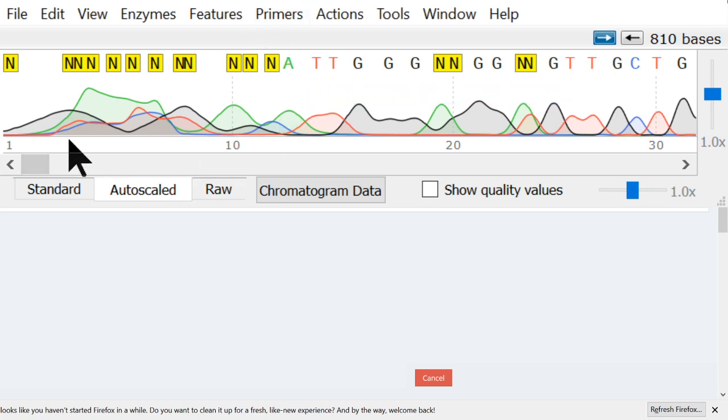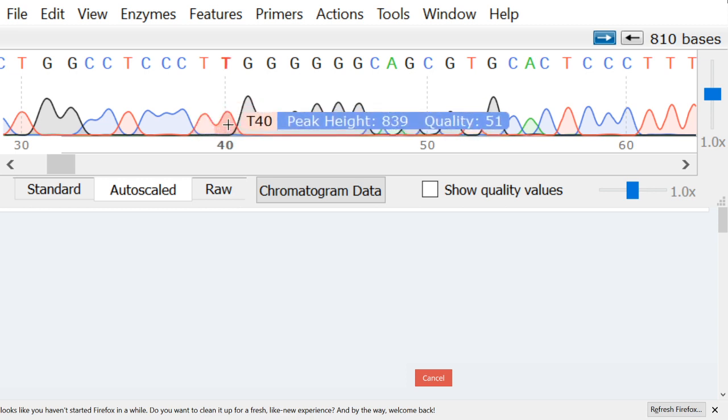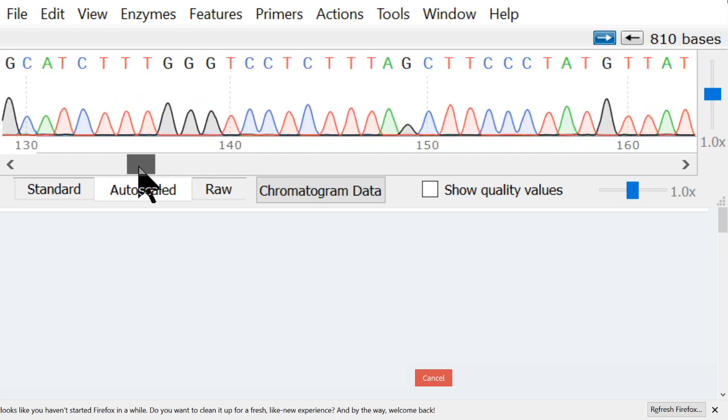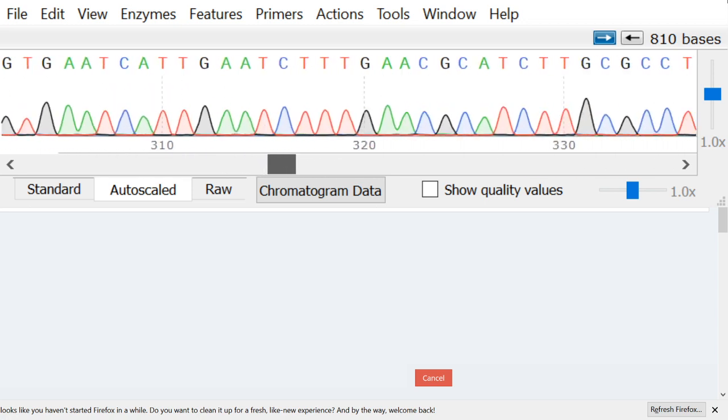So here is this Hygrocybe, and if you see at the beginning of every Sanger read, you get a lot of garbage, and that's just when it's not giving you anything useful. And then you start to get useful data, and after a while these Ns go away. And if you look in here, now you have really good data. And good data means nice, reliable peaks, one peak in each spot, no double peaks, no garbage in the background. So what we'll do now is scroll through the read and see how it looks. And this read looks really good so far.